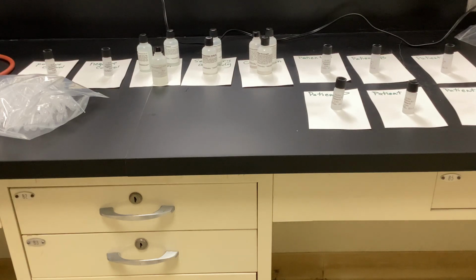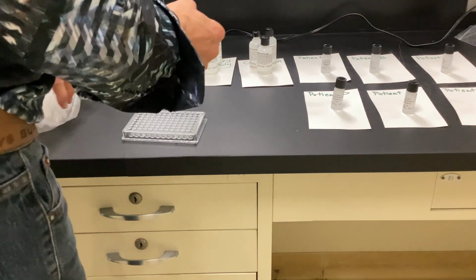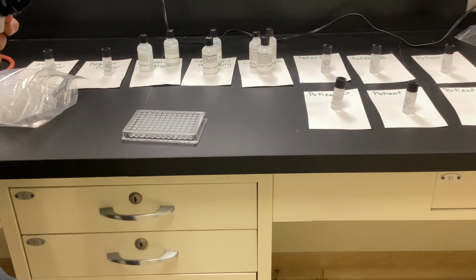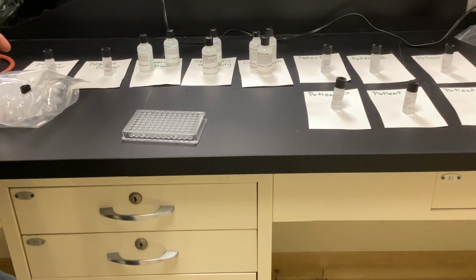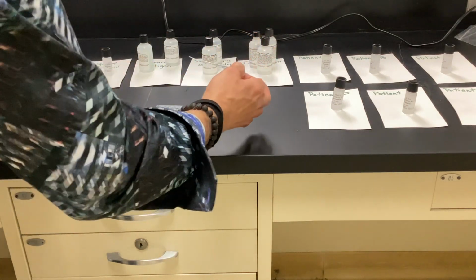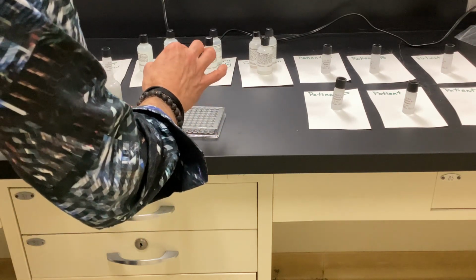All right, so what I'm going to do is I'm going to take a pipette, and what does your first line say? I'm going to put the primary antigen, 3 drops. Everyone can read? Yep. I don't have my glasses. All right. Oh, I don't like that noise. Yeah, that was annoying.